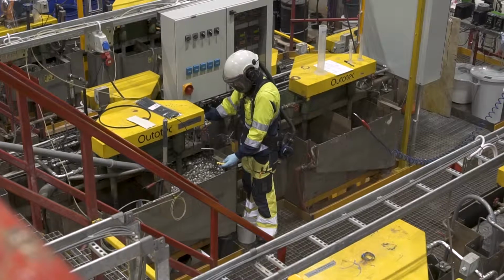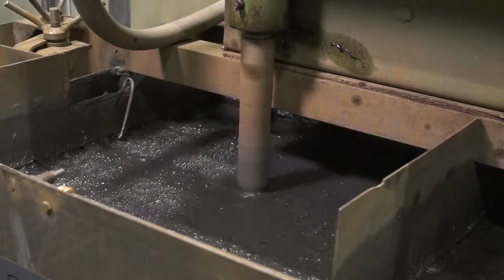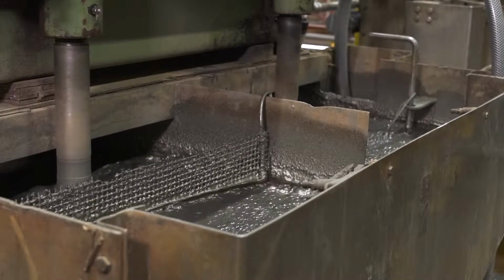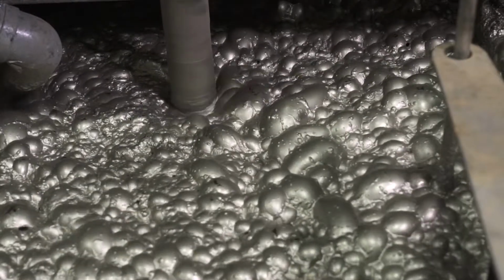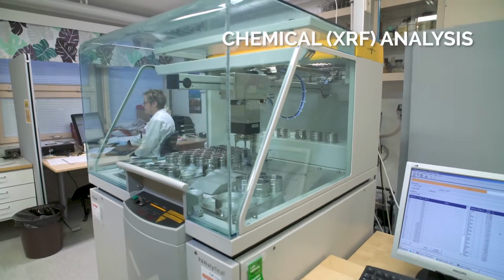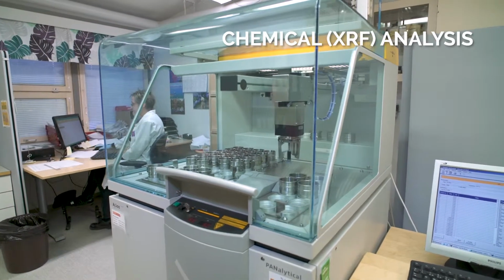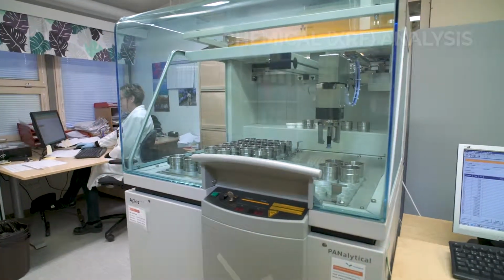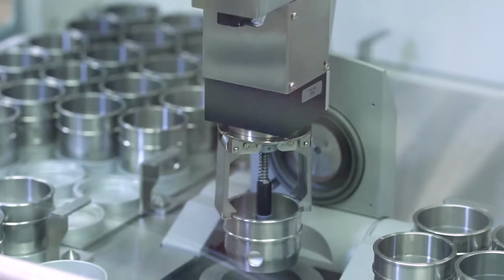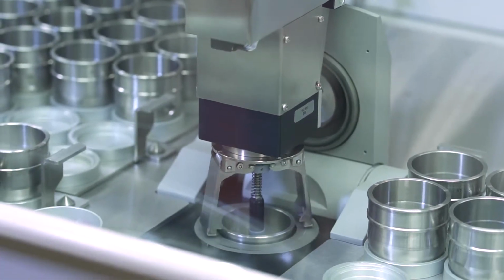Modern instrumentation connected with a process computer is used for process control and data collection. For example, online elemental and particle size analyzers. Chemical analysis, such as X-ray fluorescence spectrometry, is important in pilot plant testing for process control, which provides the data of elemental compositions of beneficiation products.